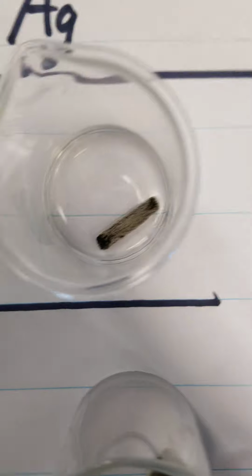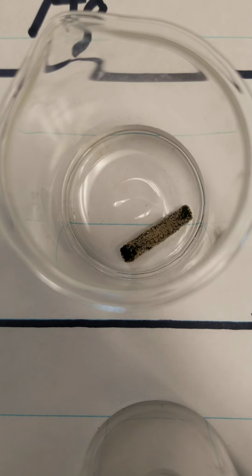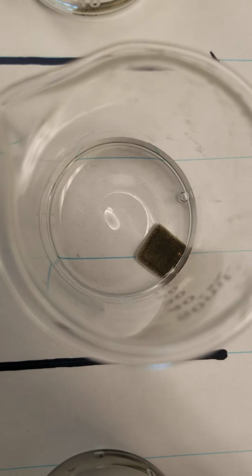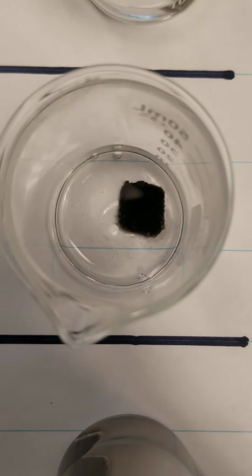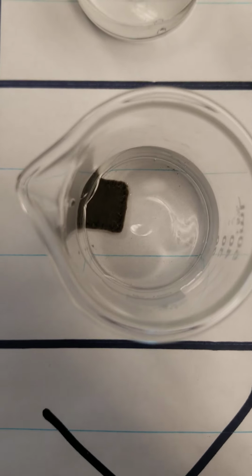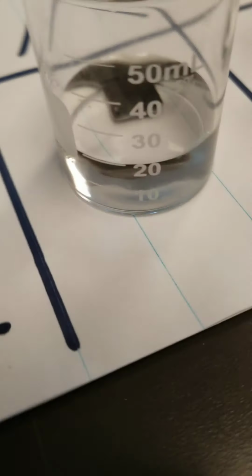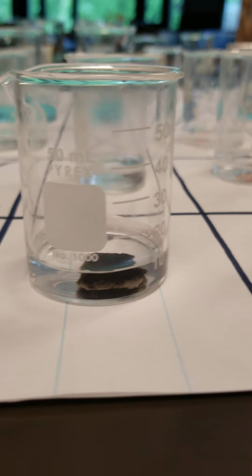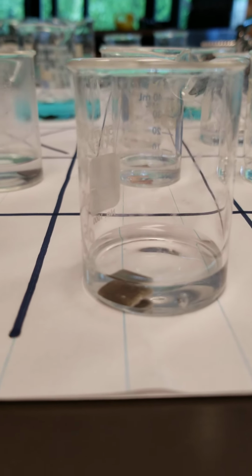However, if we look at the silver solution, there it is with magnesium. Here it is with the copper. You can just barely see that one piece of copper inside there. Here it is with the lead, and here it is with the zinc. If we come sideways here, we can notice that all these pieces of metal that were put in here have silver growing on the outside.